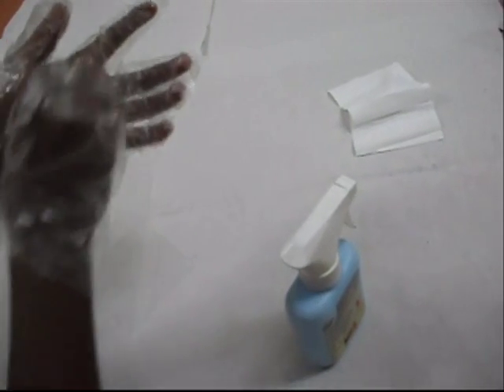Wipe the glass plates with alcohol. Fix the spacer in between the notched and unnotched plates. It makes a space to load our separating and stacking gel.